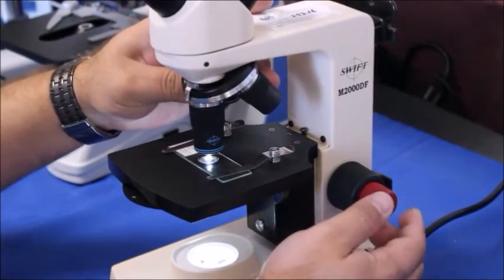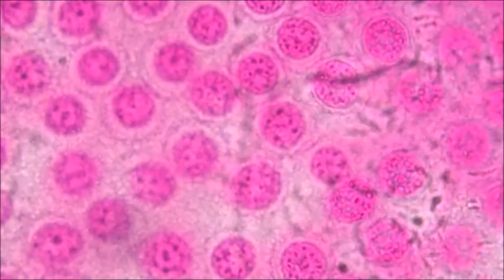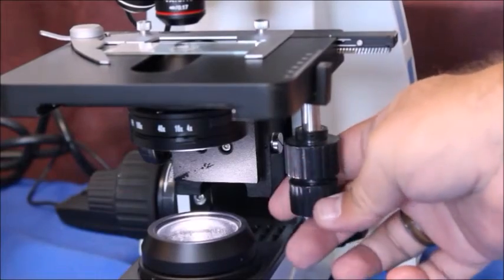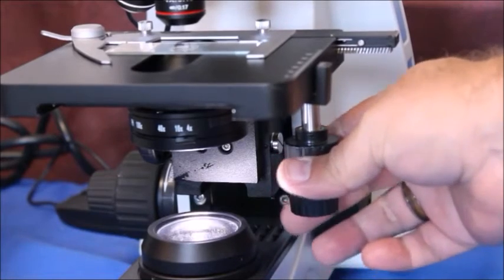Then you can move it up to the 40x objective, and then again you're just going to fine-tune it a little bit until you get a nice image there. Now you can move it around with your hands, or you might have something like a mechanical stage like this microscope over here has. I'll show you guys a close-up of that.